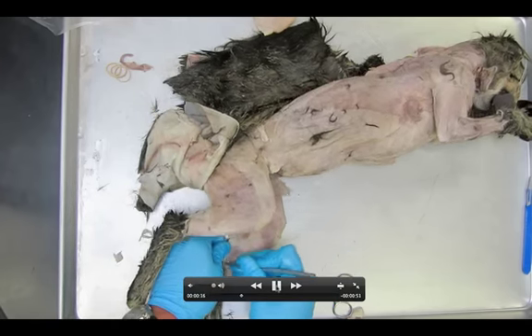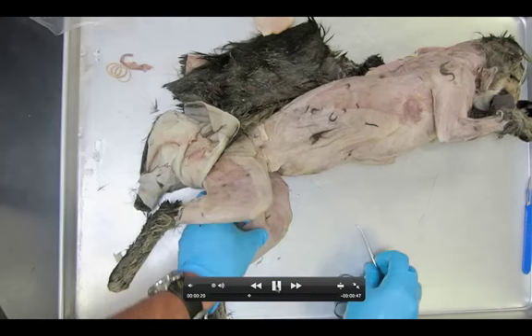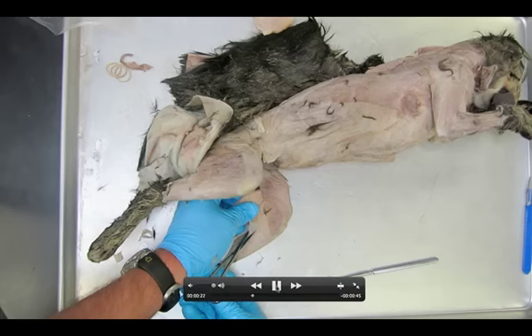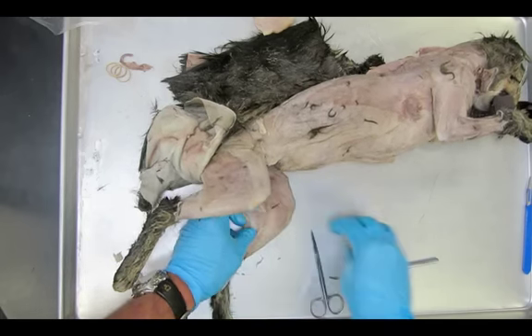First, you're noticing we've got to dig through some of this fascia — this white fibrous tissue that's all over the place. You might need to be careful that you don't accidentally completely remove the gracilis, but you can partially fold it back a little bit.